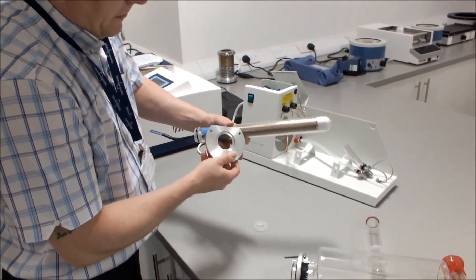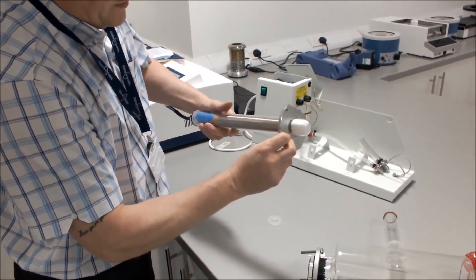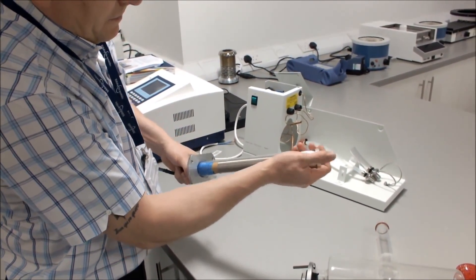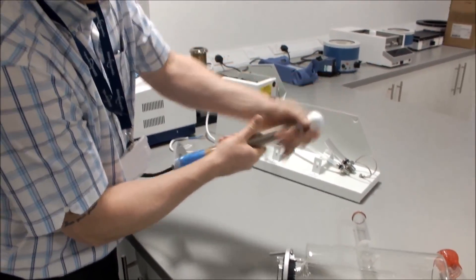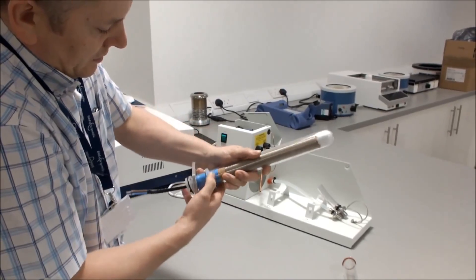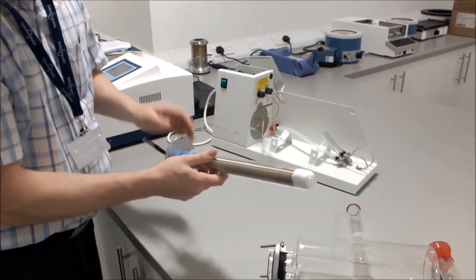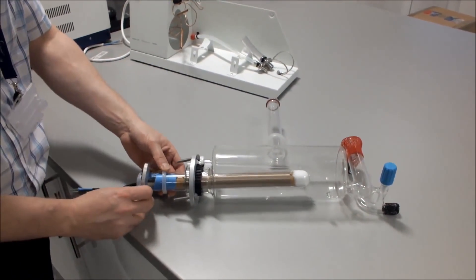Take the aluminium plate — it has a groove on the inside which faces the actual boiler. We then take our aluminium silicone seal and put it onto our heater approximately 40 to 45 millimetres from the end. We then take our heater and place it inside our boiler.